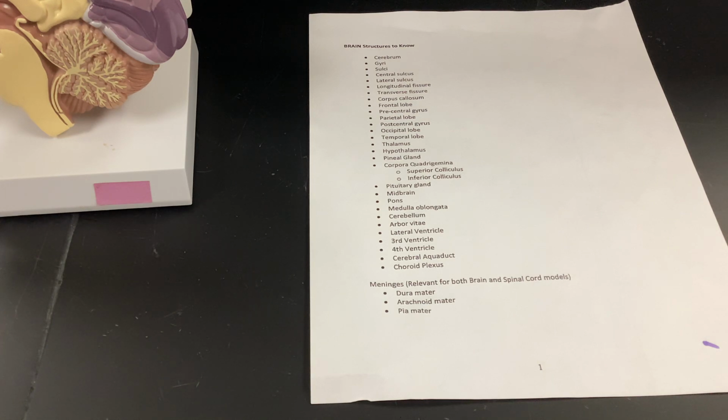And we talked in the lab on Saturday. I talked to the other students Wednesday night. Literally remember that the choroid plexus and the ependymal cells make that cerebrospinal fluid. So not only is it feeding your brain via your blood plasma, there's also the blood-brain barrier, filtering things out and not letting things in.